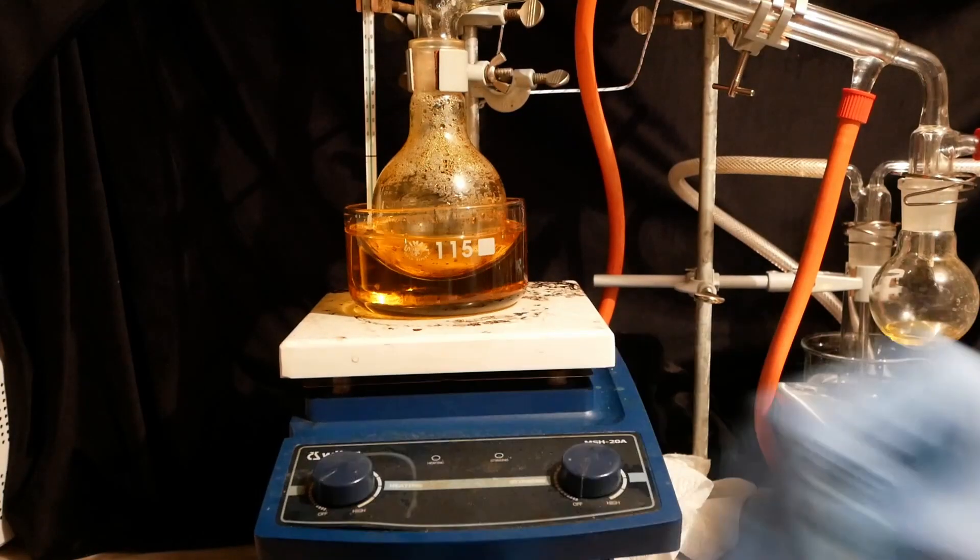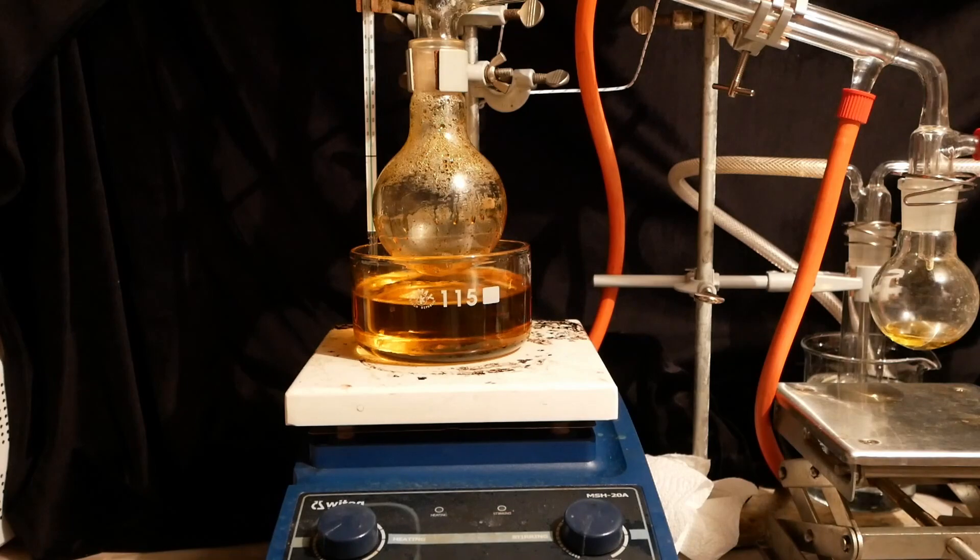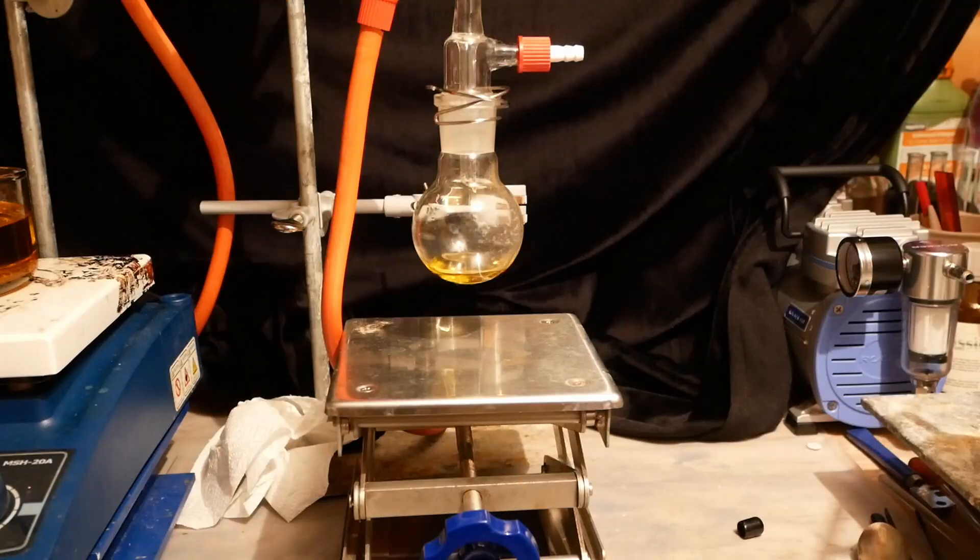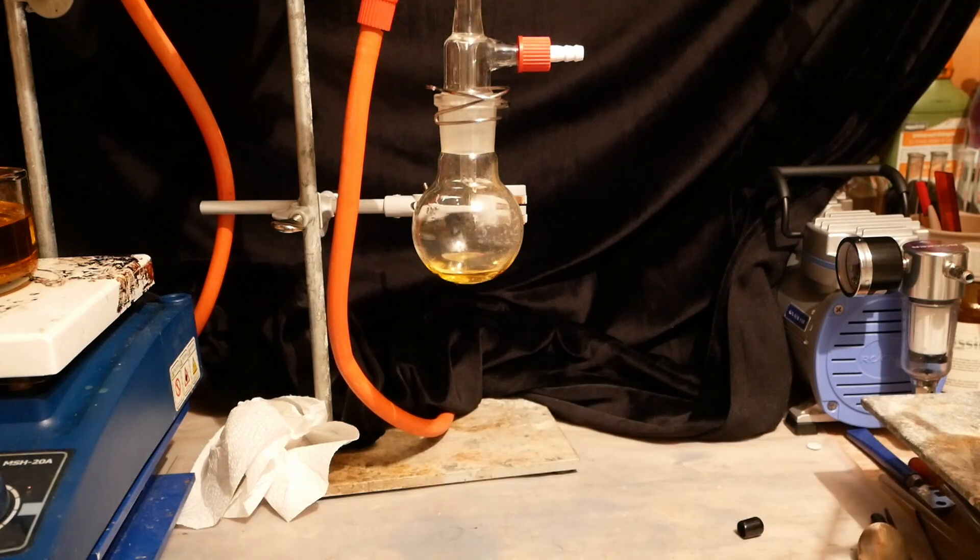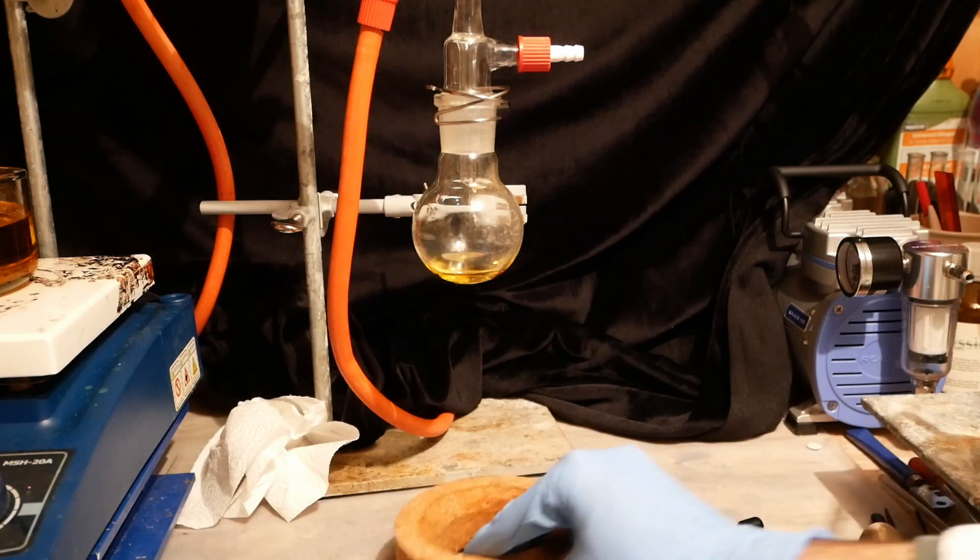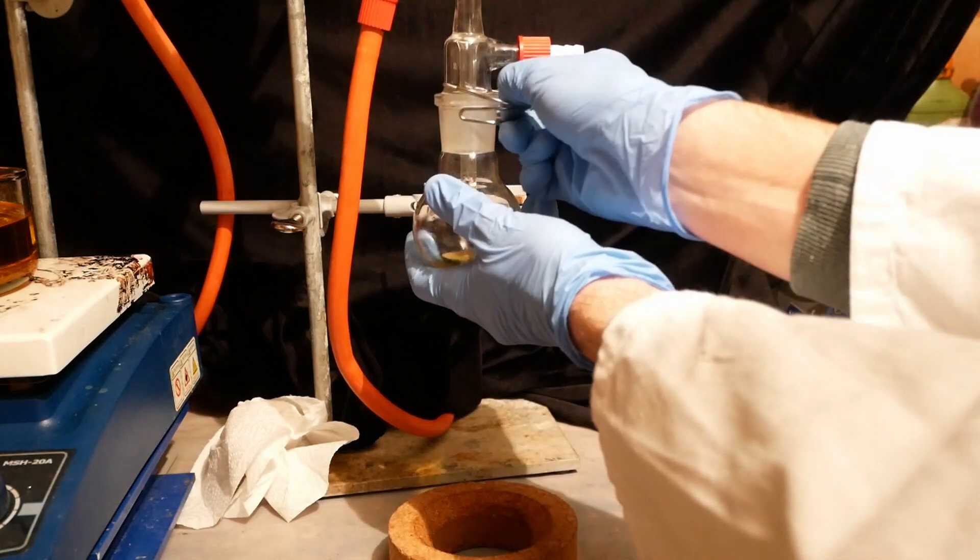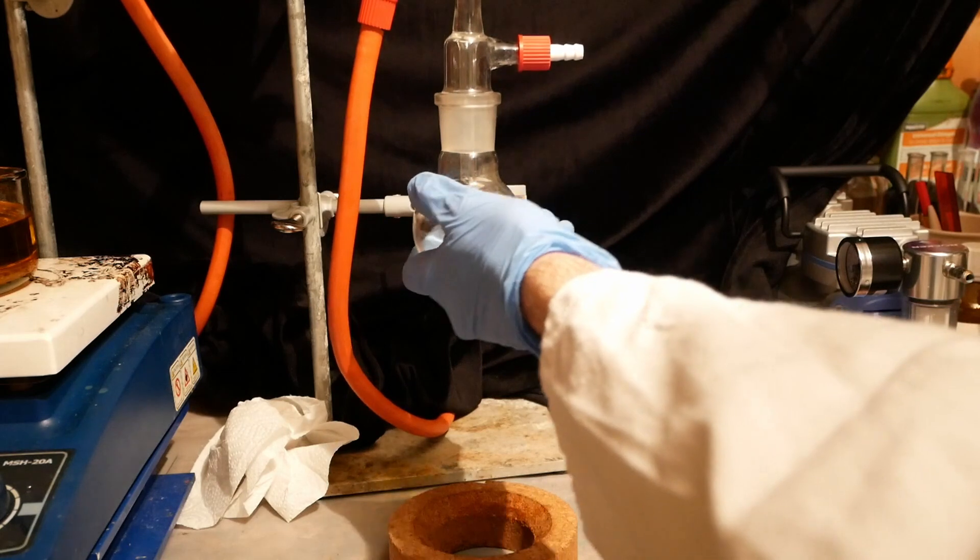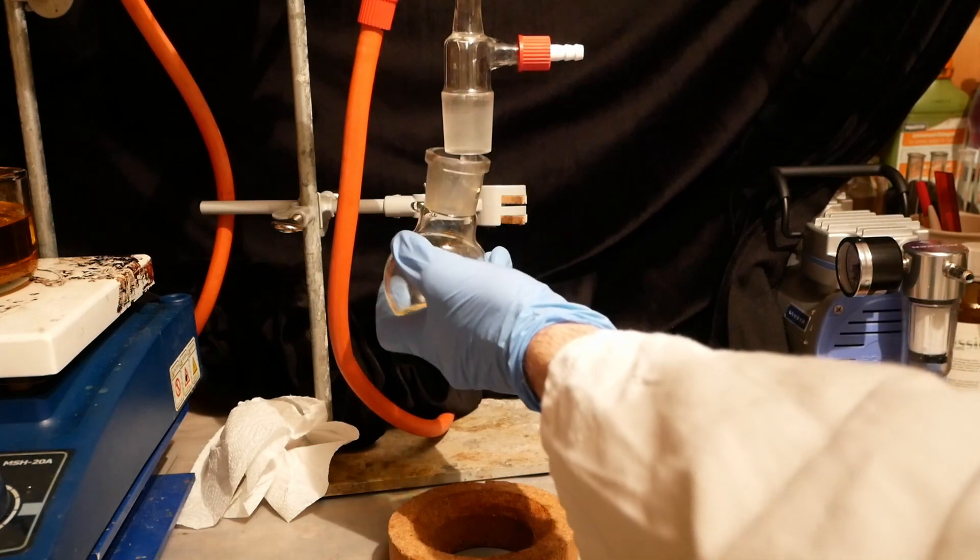Almost all of the crude product came over and we're left with a few droplets of brown heat junk in the distillation flask and some piss yellow aniline. So there's still some impurity left as pure aniline is almost colorless. It doesn't matter though as this is going to storage anyway and aniline gradually turns into red gunk as it gets older and I'll have to redistill it anyways.